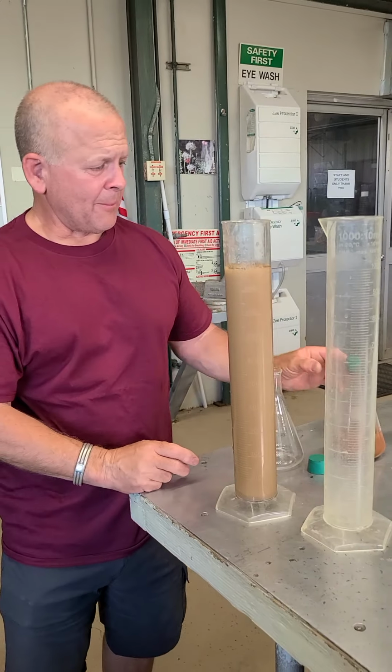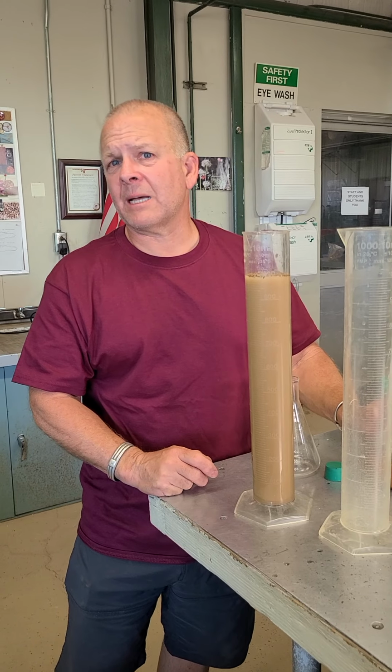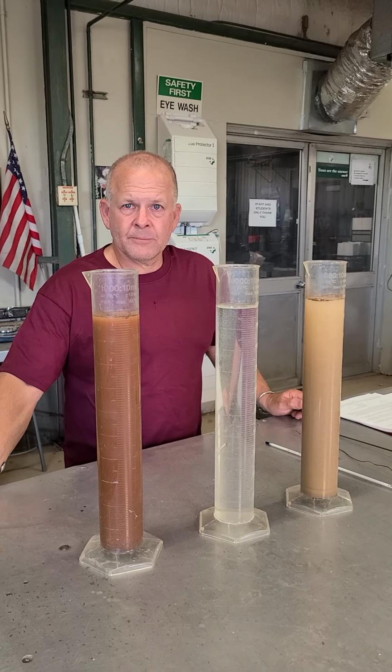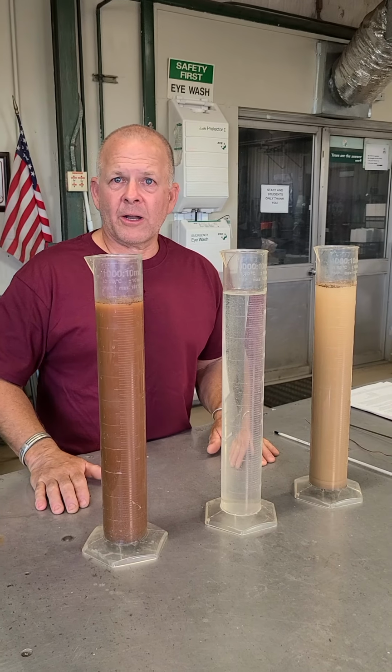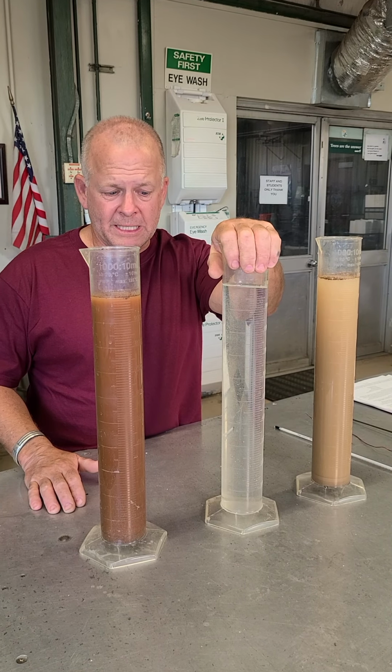I'm going to go off camera and prepare the other sample. Then I'm going to show you the next step, which is to actually run these things. So we have one sample ready to go. Okay, here we go. We've got our two samples, and you'll notice we actually have another sample here in the middle. But this sample is clear.